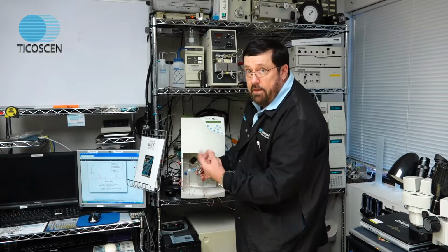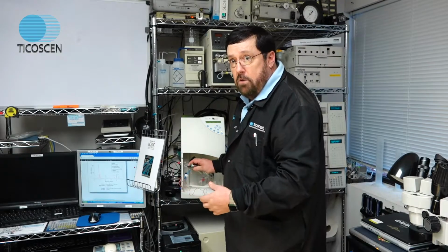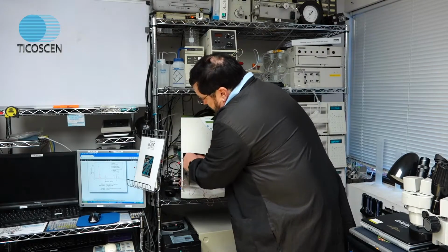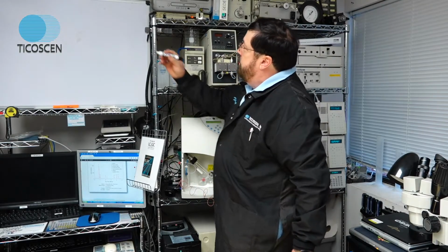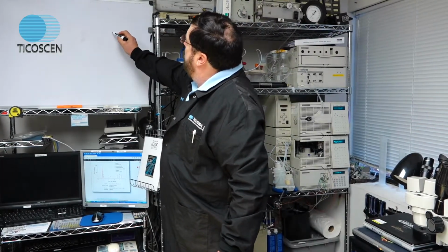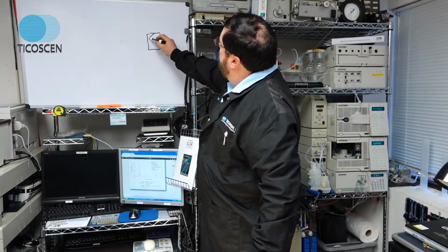So sonicate it for maybe 3 minutes, put it back in the detector and wait about 10 minutes for it to calm down, and your nebulizer will now be clean. And I will show you what a partial submersion sonication looks like. You have a small 100 ml beaker. You put your nebulizer in there like this.